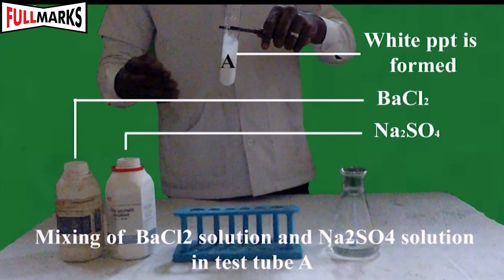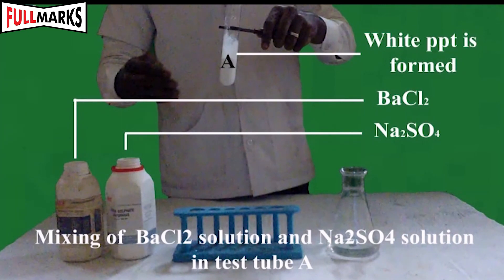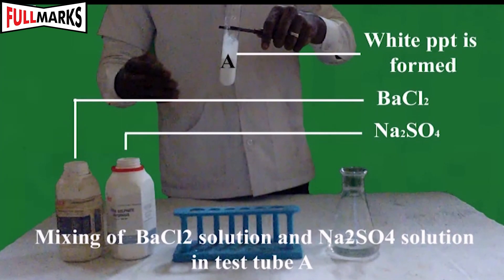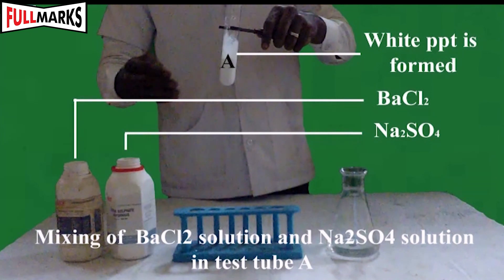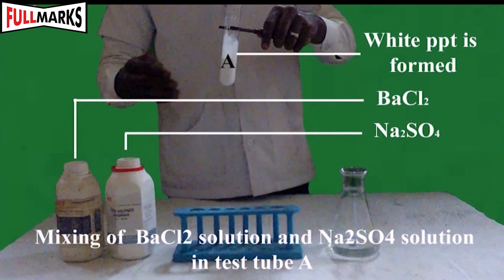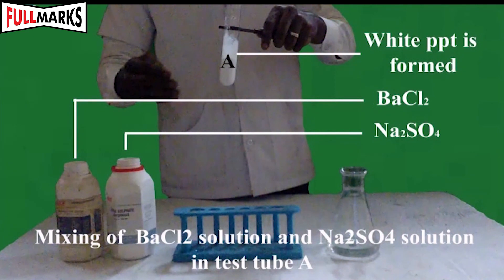Procedure 5: Take a solution of sodium sulphate and barium chloride and mix them. A white precipitate is formed on keeping the test tube on a stand for some time. Two layers are obtained — barium sulphate precipitate and colourless sodium chloride solution.